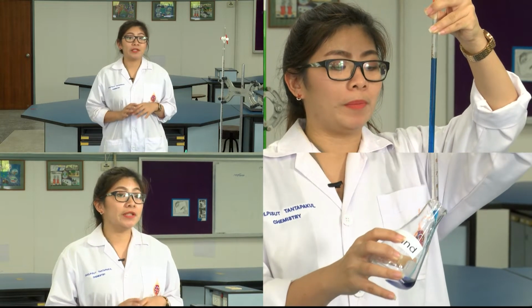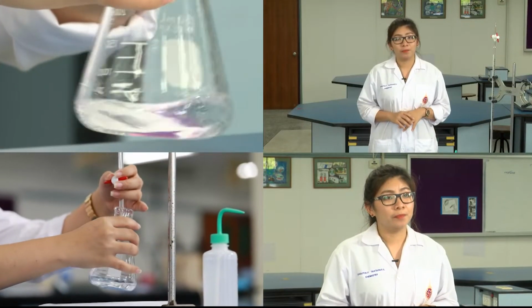First of all, we should know what an acid-base titration is. The acid-base titration is the most common analytical technique in all of chemistry. It is used to determine the concentration of a reactant using a reaction with a standard solution of known concentration. This reaction is referred to as an acid-base titration.